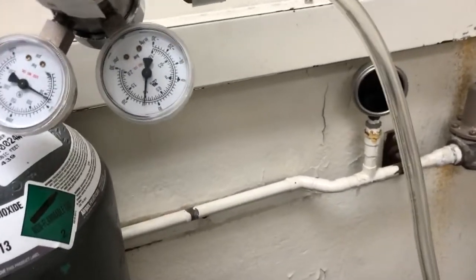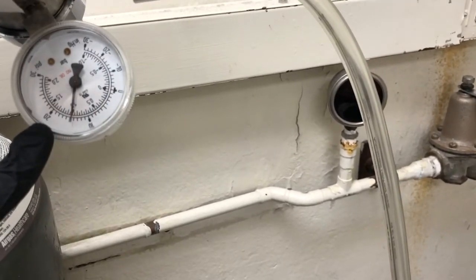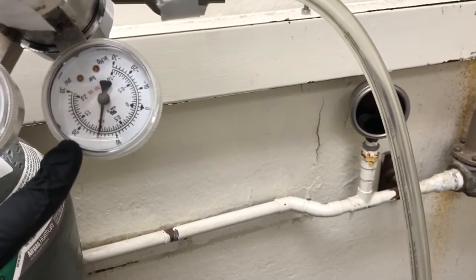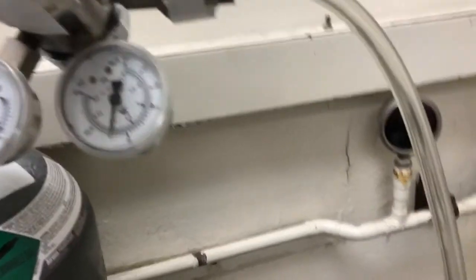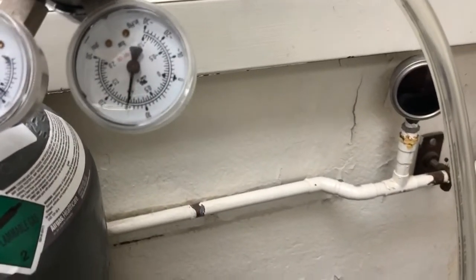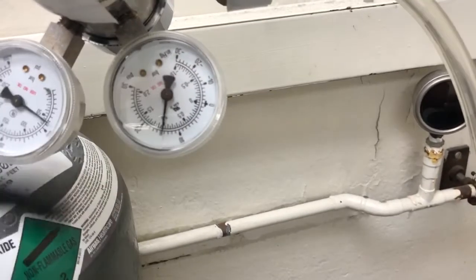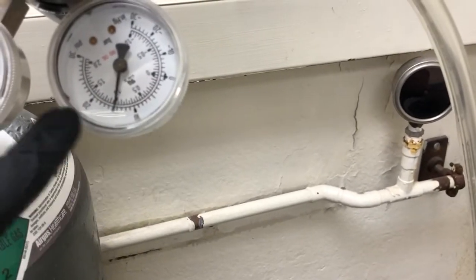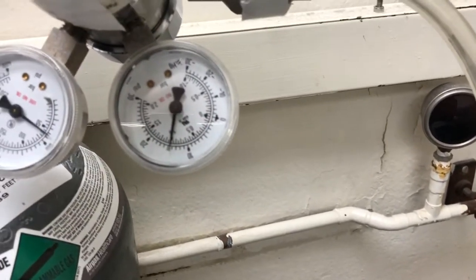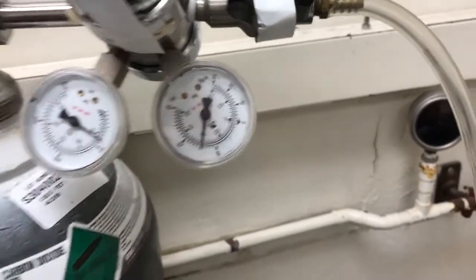And you can see here, this is the amount remaining in the tank. And this represents the pressure of the air coming out. It should be at 15 pounds per square inch, or PSI, which are the outer numbers. The inner numbers are, I think, inches of mercury. So you can see the outer numbers, it says 10 here, it says 20 there, and so it's in the middle, it's at 15. So that's good. That's done. Let's look at the next step.